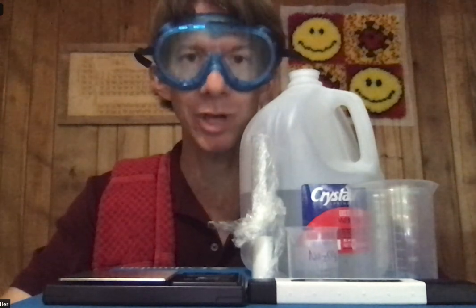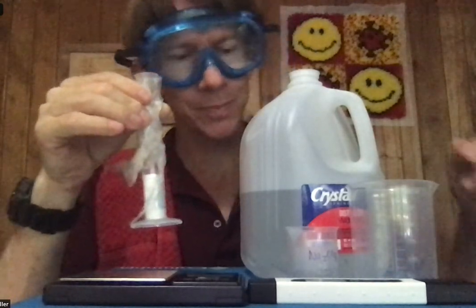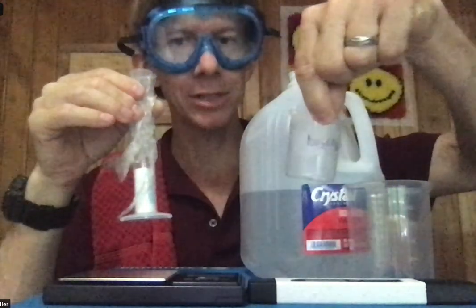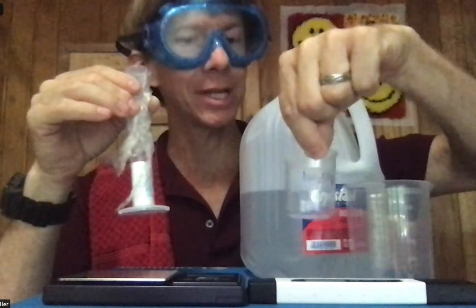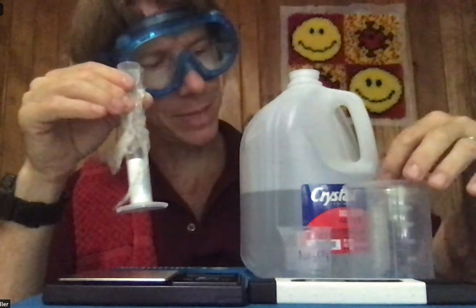The important things are knowing the mass you're using. The ice cube should be approximately 20 grams — I have a regular ice cube tray and my cube came out to 18 grams after measuring it. Other than that, I've got my sodium carbonate from experiment number four, which I will pour into my 50 milliliter beaker to take its mass.